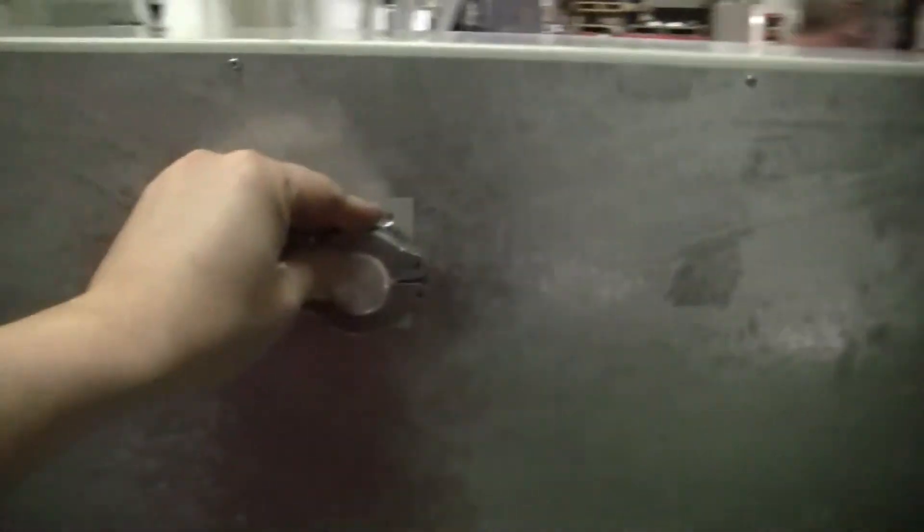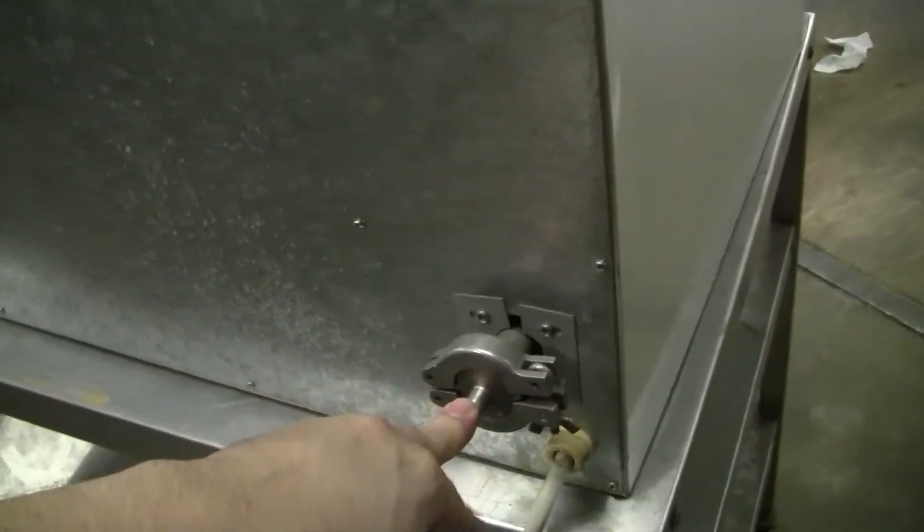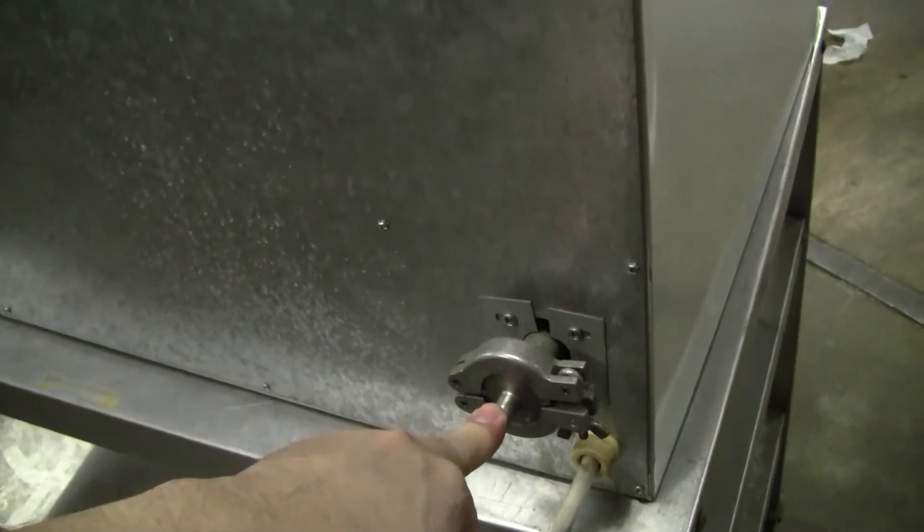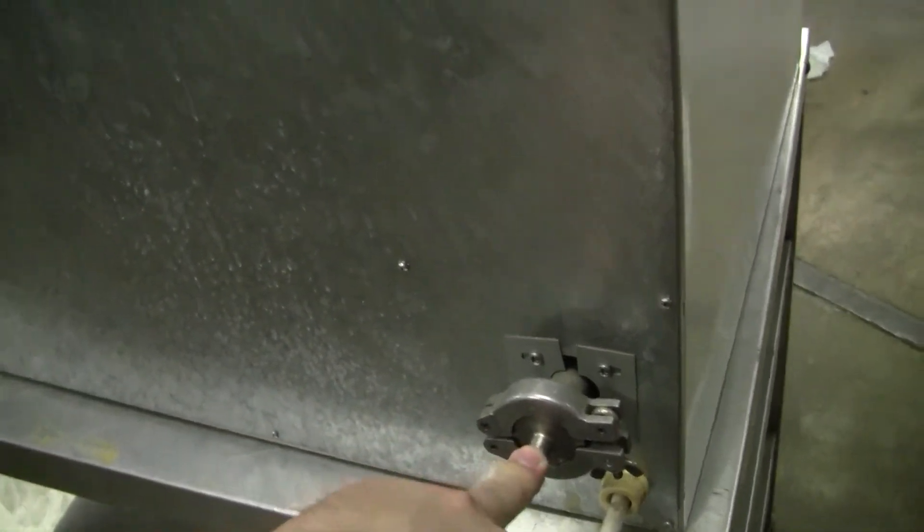On the rear of the unit, we have a capped vacuum port which you might be able to put nitrogen in. And that is the vacuum in where that shutoff valve was in the front.